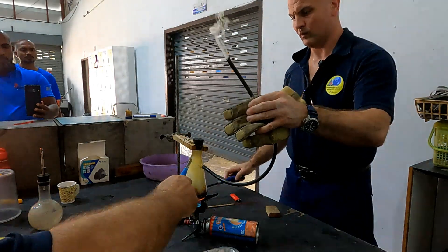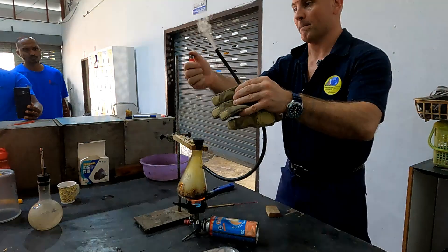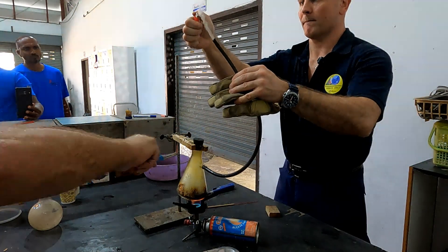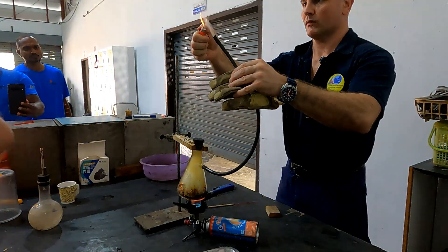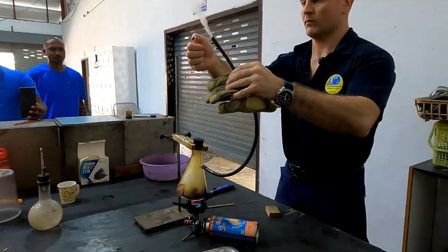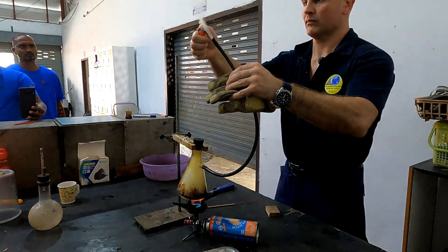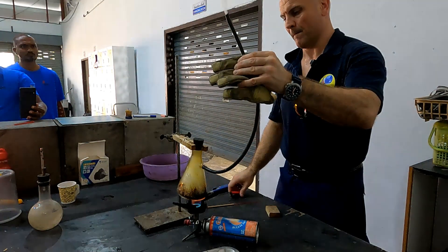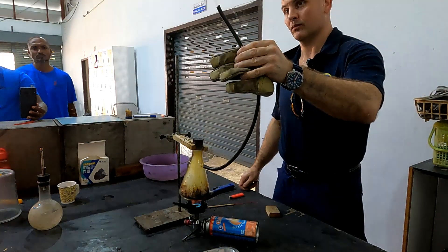If you look carefully now, you can see flowing down that flask is liquid. Some of that liquid is water, and some of it is actually tar — that's got that brownish yellow colour. So tar is not actually a gas, it's an aerosol. A gas molecule is just one molecule of that substance, while an aerosol is three or four clumped together to make a little liquid droplet.